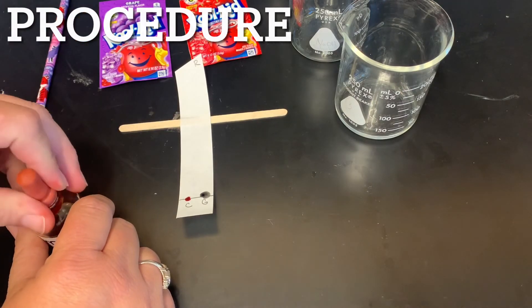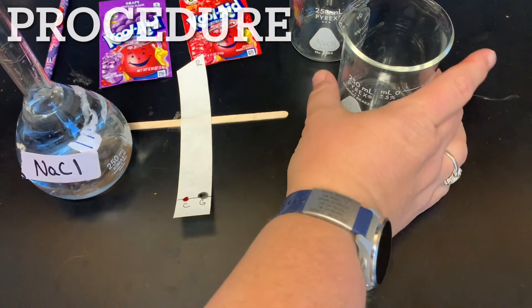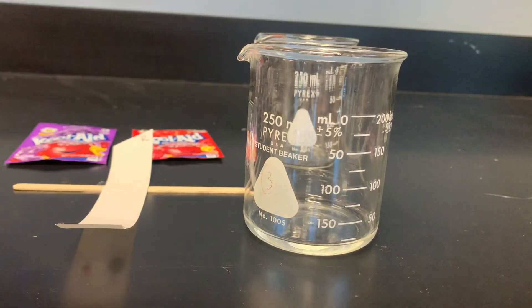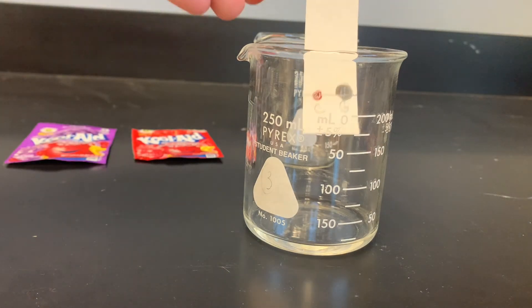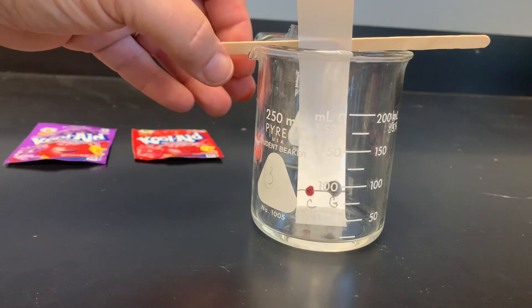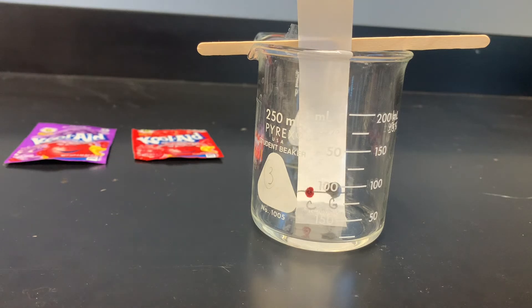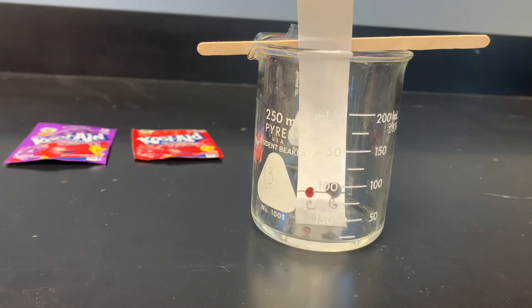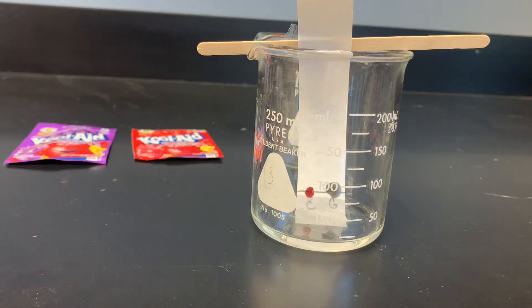Once I have that, I'm going to get a little bit of this sodium chloride solution and pour a thin layer at the bottom of the beaker. I don't need a whole bunch — just enough. Then I'm going to stick this in my beaker. As long as it doesn't fall over, we're good. I'm going to let it sit there and allow the solution to come up through the paper. Give it time — it should take about 10 to 15 minutes.